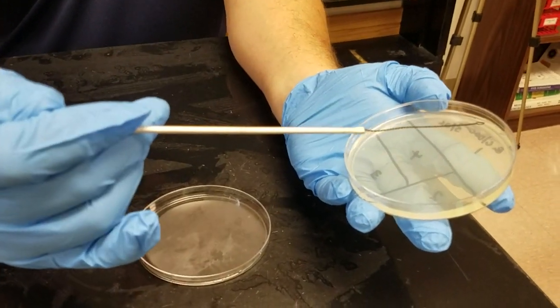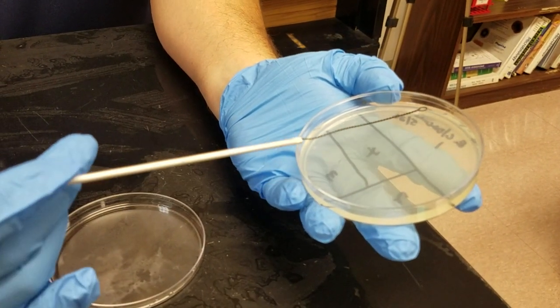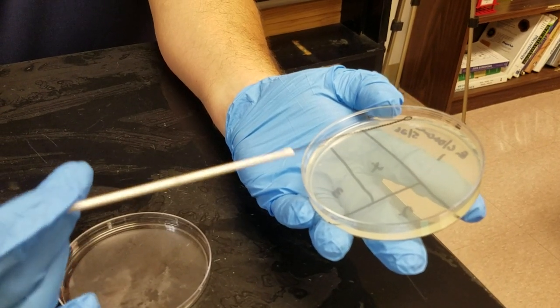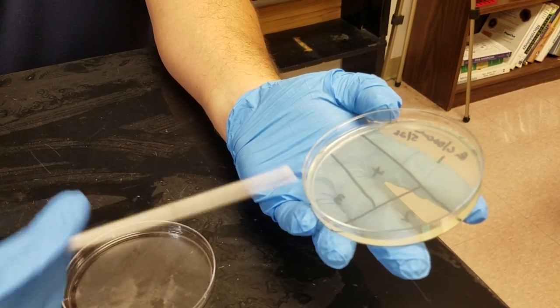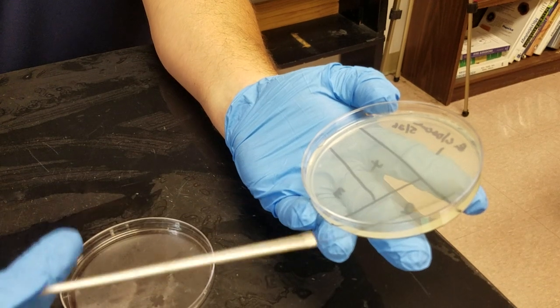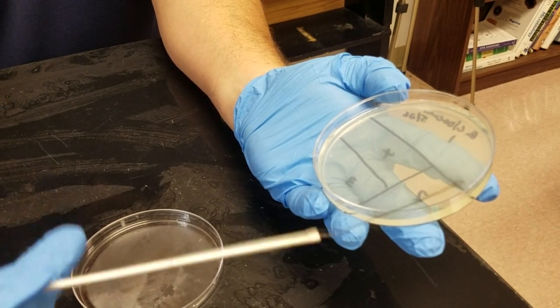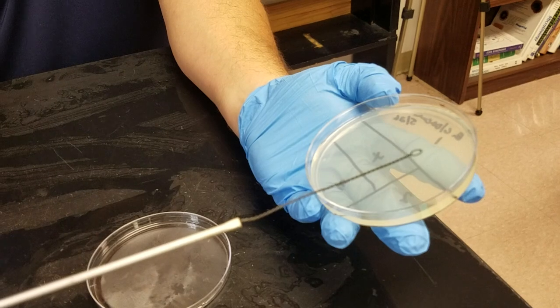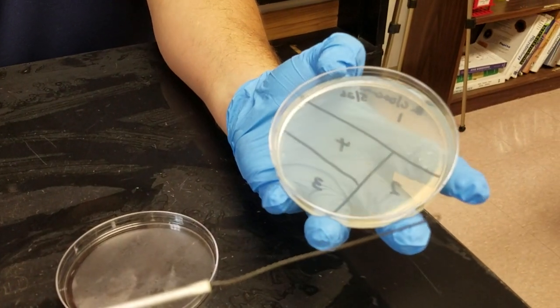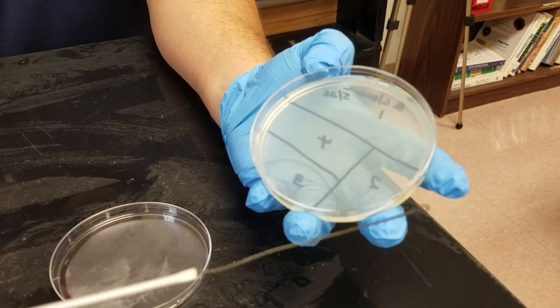Now I can engage that one drop of suspension without causing an aerosol. I'm going to transfer that one drop of organism throughout that entire first quadrant, going in only one direction and not digging into the media. That is the first quadrant really nicely streaked.